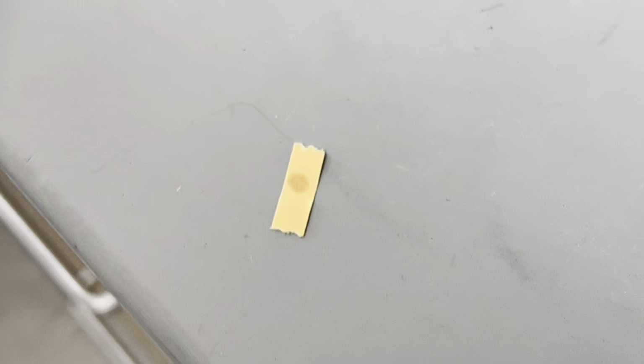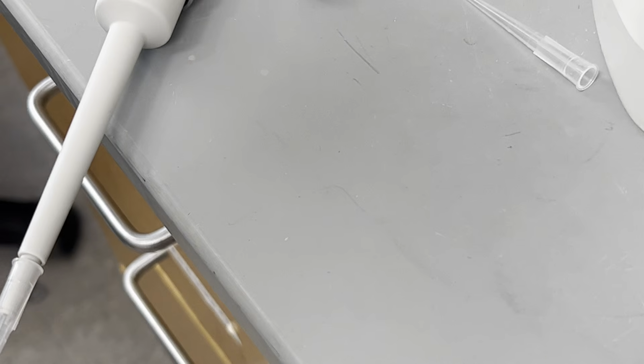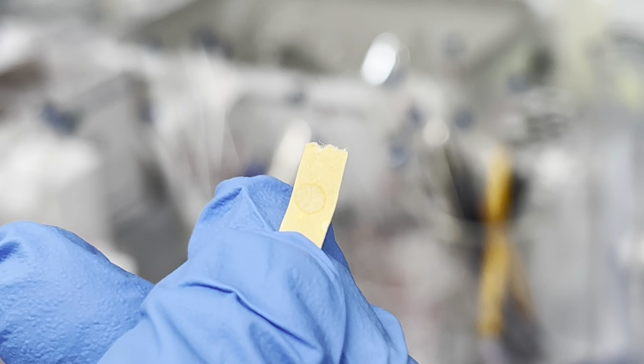Remember, this is supposed to be green. Not green. Oh, this is not green. You said it was green. It will be a little pinkish. Oh no, but is the paper itself green? Yeah, I don't know. I'll just take your word for it every time. Ooh, what is this? Looks green to me. Not green yet. Oh no, yellow. Oh wait. Okay, whatever color that is. Yeah. But still, is that not pinkish or red? That is pinkish. Wait, not this one, this one.